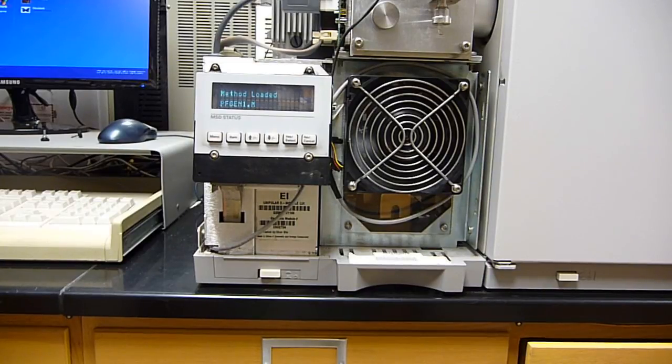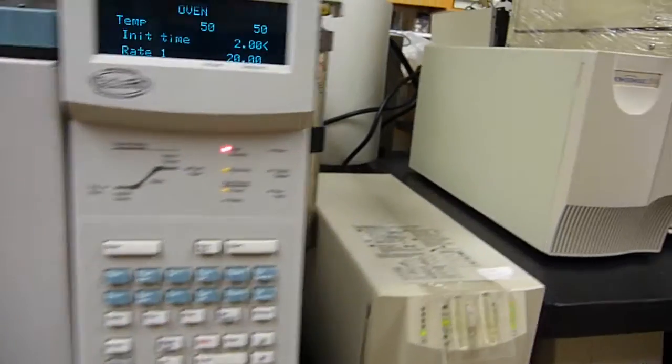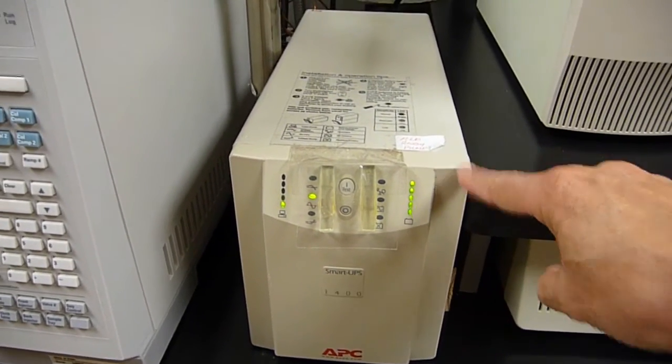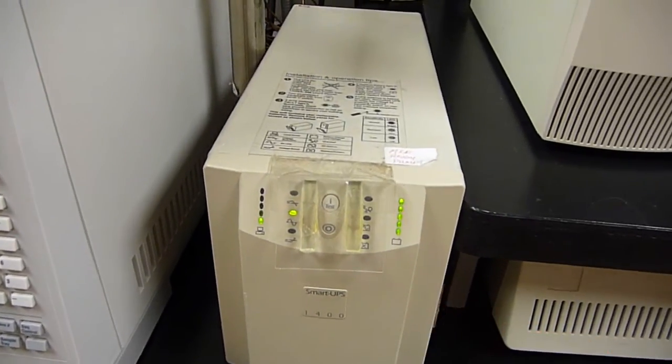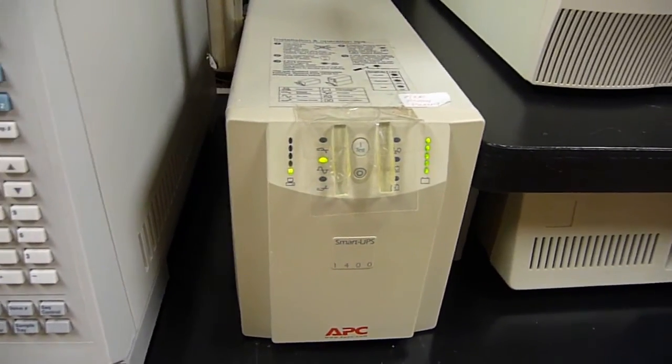If the power gets cut off to the heater, the diffusion pump is still going to work for a while. So what we wanted to do was, if we had any sort of power outages from ice storm or electrical generation problems, we want to be able to have the rough pump keep working and the diffusion pump, even if it doesn't have power to it, still have the cooling functioning. So one way to do that is UPSs. The rough pump has its own separate UPS, 1400 watts. Right? The power gets cut. This baby will keep that rough pump going 20 to 30 minutes, long enough for the diffusion pump to get nice and cold.